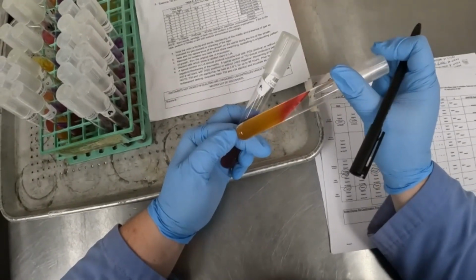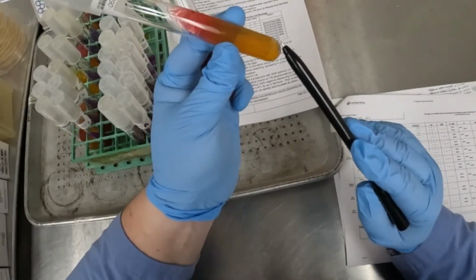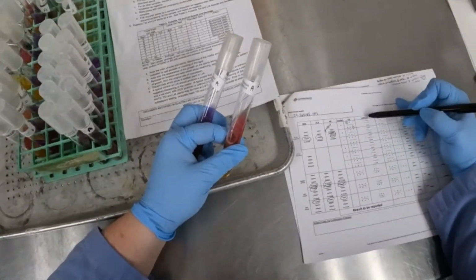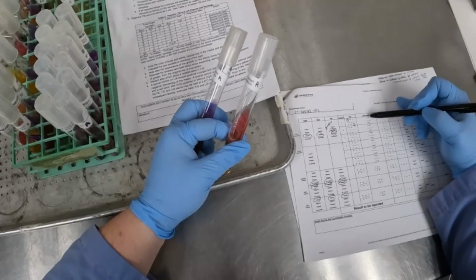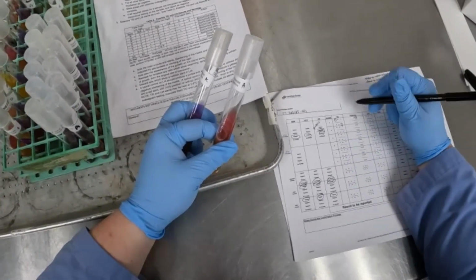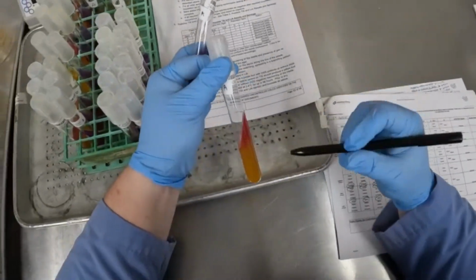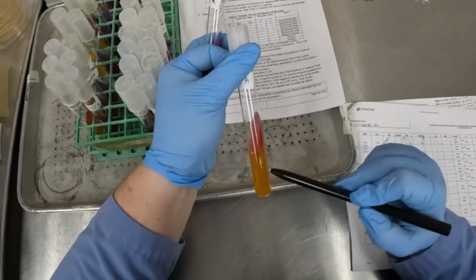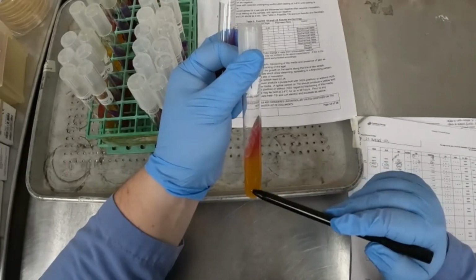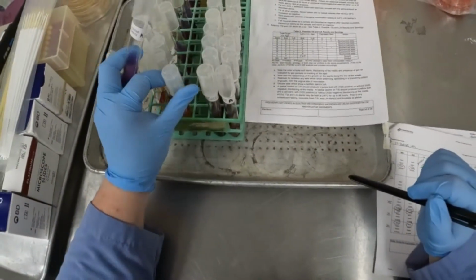You can see it right here at the end of the butt. So H2S, whatever is listed on top or first goes on top, and gas would be on the bottom. So we have N for no for H2S and Y for yes for gas. So R over Y. There's actually another air pocket right there. No for H2S production, but Y, yes for gas production.